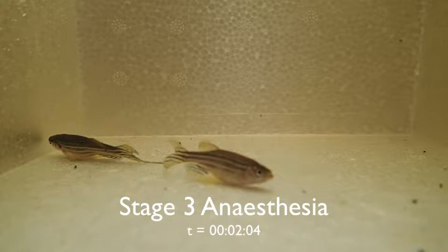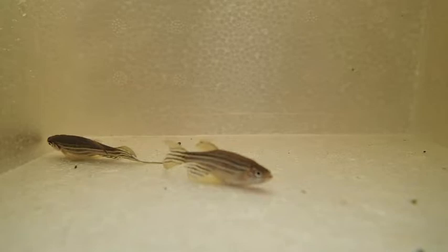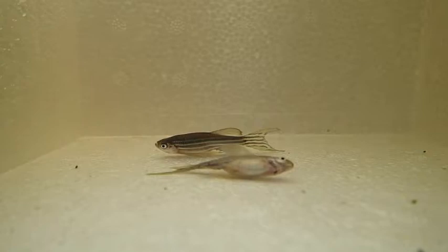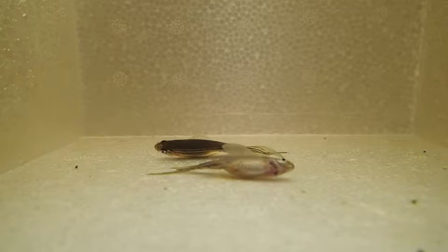In stage 3 there's partial loss of equilibrium and muscle tone. You may see erratic swimming and increased respiratory rate, and they react only to strong stimuli. This is sort of the excitatory phase, though different fish may react differently — some fish do go through that more visibly than others.